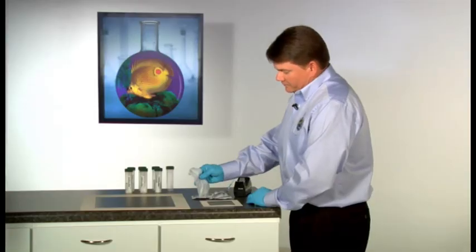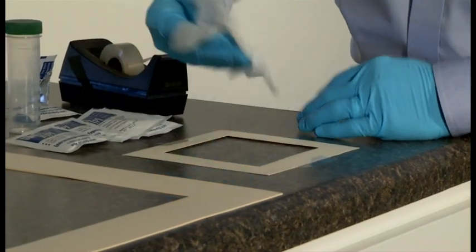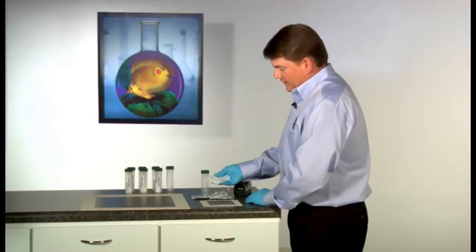Repeat the wipe in an S fashion from top to bottom. Fold the wipe again.